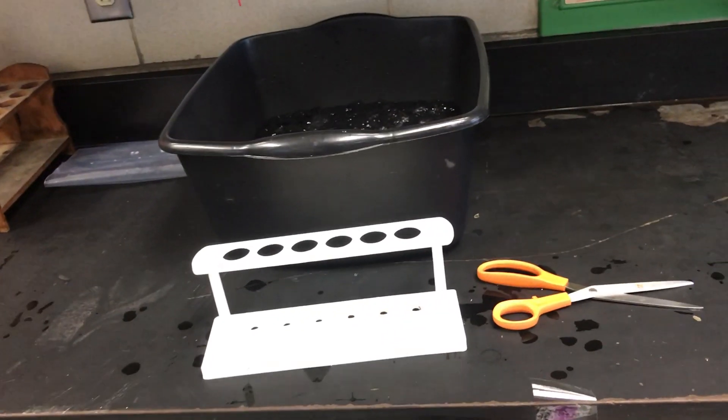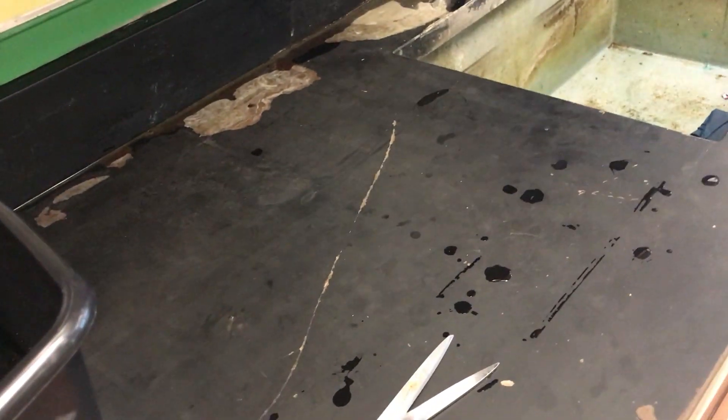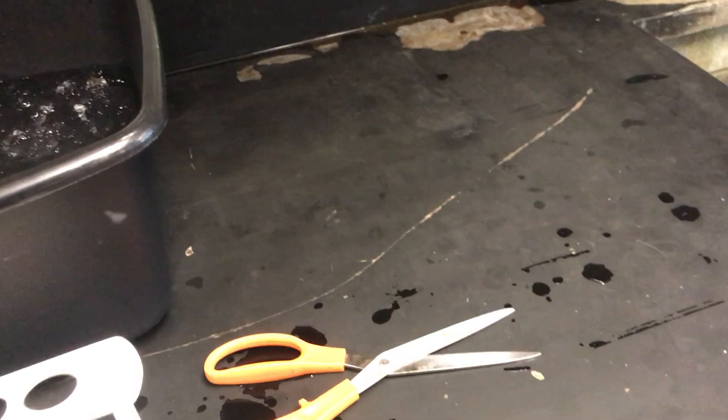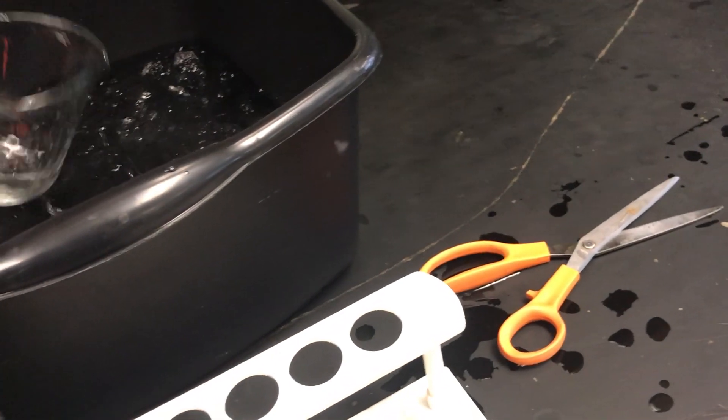Only one person—your materials manager, lab aid, or whatever you want to call it—is going to come over here and do the first step, which is to get a test tube and fill it with cold water. I put a measuring cup in there to make it easier. Try not to get any ice in it.